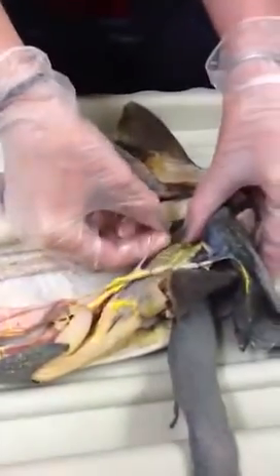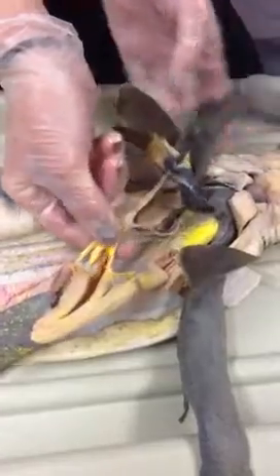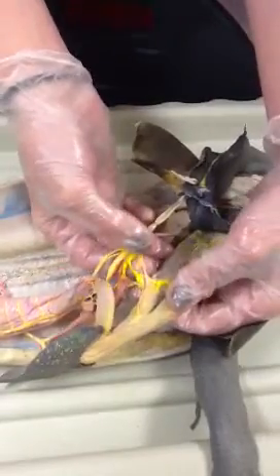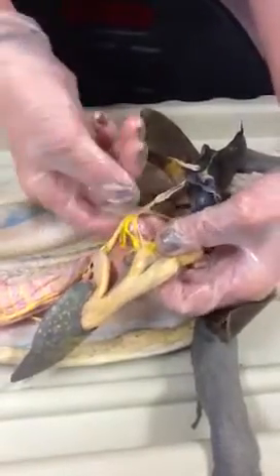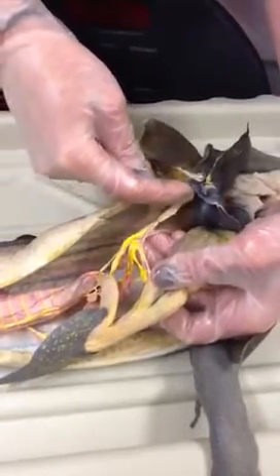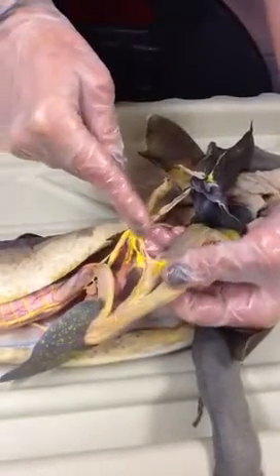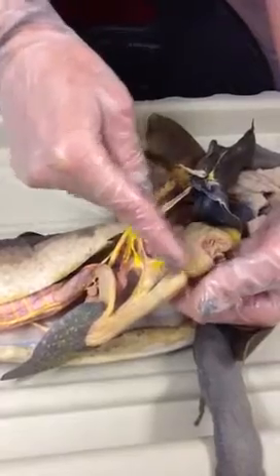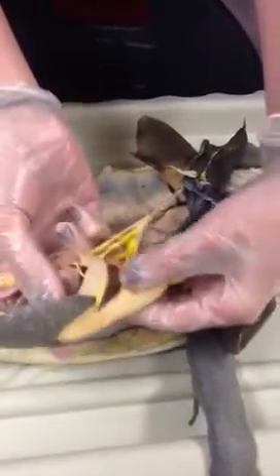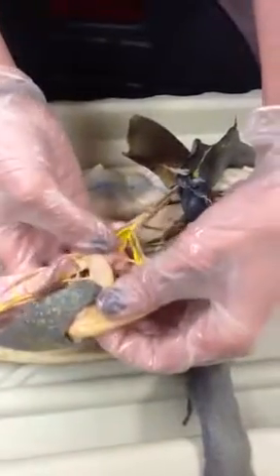So here is going to be our celiac artery that comes and joins with our hepatic portal vein coming down here. Our celiac is the one that branches 3 times. So we're going to have our hepatic, which is going to travel up back to the liver. We're going to have our gastric, which is going to go into the stomach, and then we're going to have our splenic, which is rather hard to see, and I don't see it on mine.